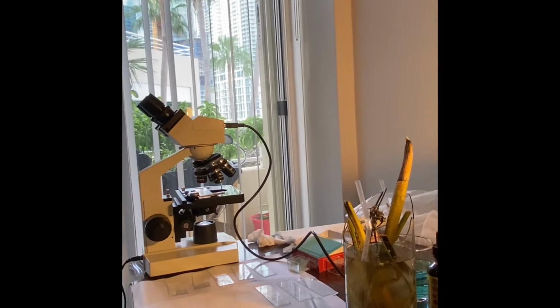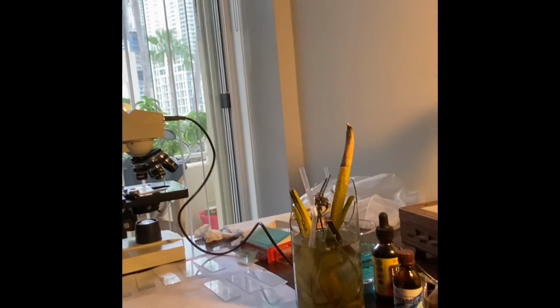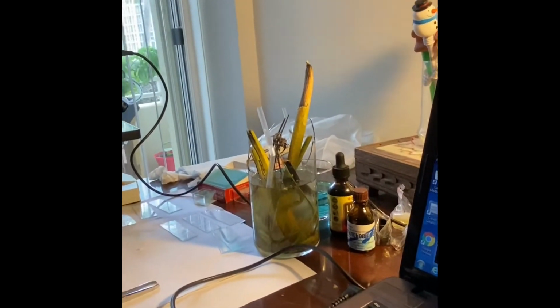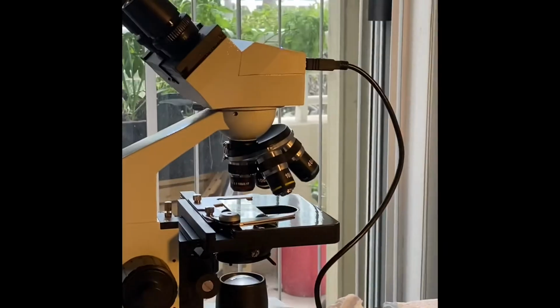Lesson number 7 is a drop of pond water. A drop of fresh water from a pond, lake, or stream has an amazing amount of microscopic plants and animals. Only microscopes will allow curious people to see this hidden world.